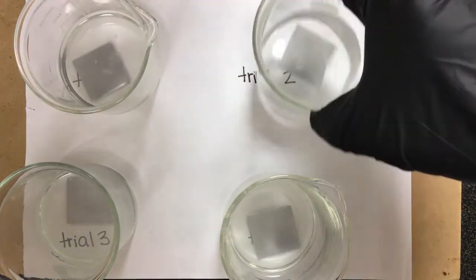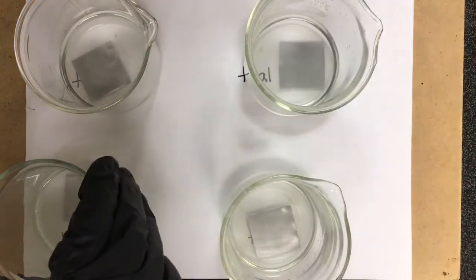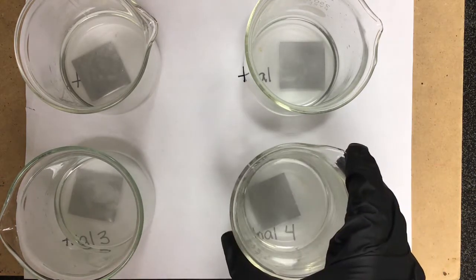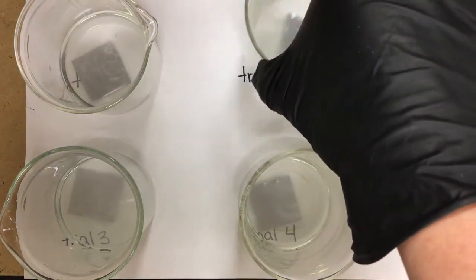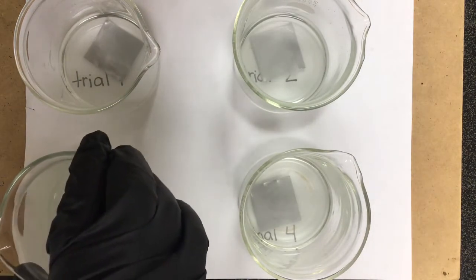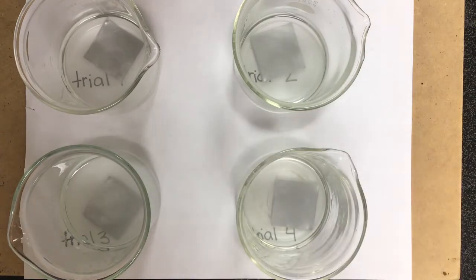And really, it is important to be patient. The other thing is we don't want this to start overreacting. So if we start seeing a color change in the reaction beaker, it just means that we went a little bit too far. That means that the hydrochloric acid would have reacted with the zinc and would have removed the zinc, but then it would have also started to react with the iron. So we're gonna go ahead and give that a little bit of a swirl. And again, we're just making sure that no major color changes are occurring. Still some really good bubbling happening there.